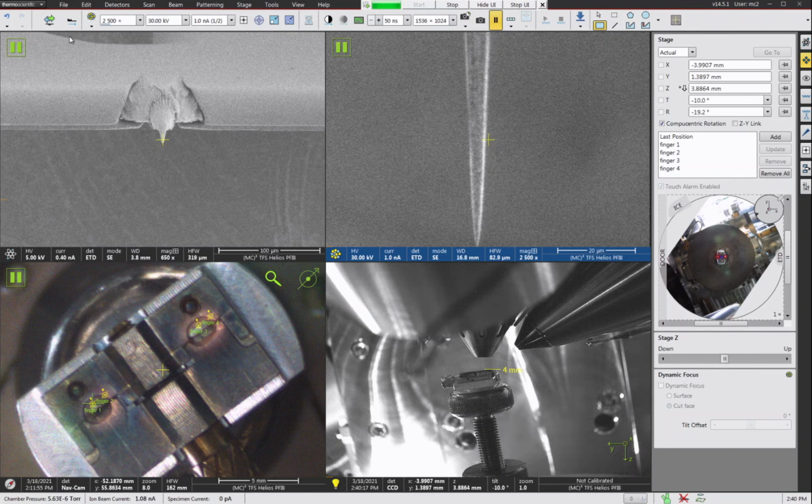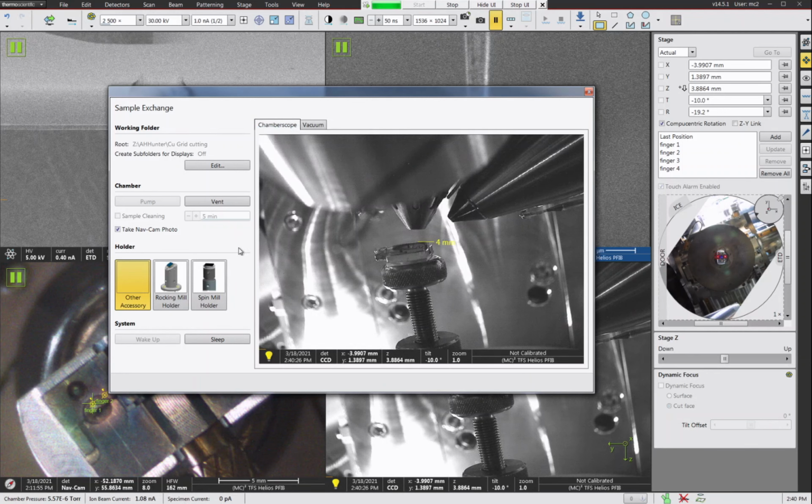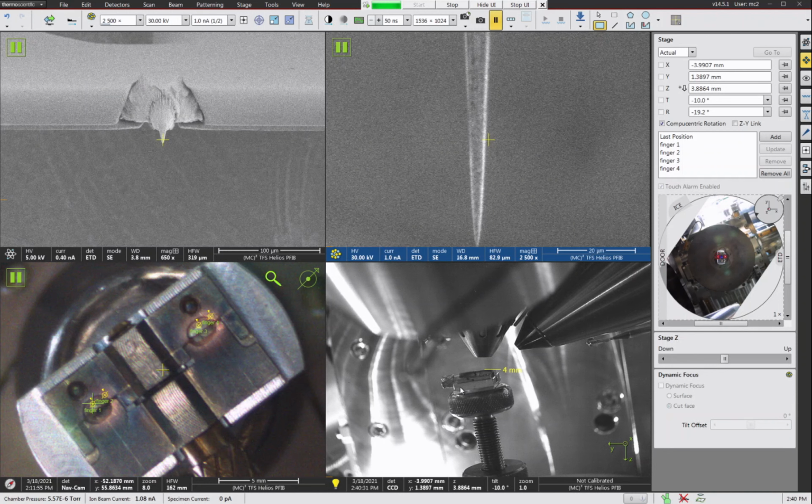In order to do that, you have to open up the sample exchange window, and you have to tell the system you're using the spin mill holder. Otherwise, the software will not allow you to go to the minus 38 tilt. I'm going to choose a spin mill holder. Now, the other thing that you have to keep in mind is you have to have your sample in the center of the stage. So I'm using a single stub holder, and I have everything right here in the middle. If you're using one of the cross holders and your TEM grids are out on the outside arms of the holder, like way out here, the software is not going to let you go to minus 38 tilt.